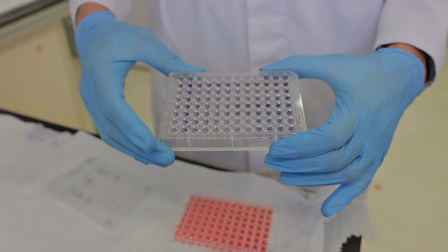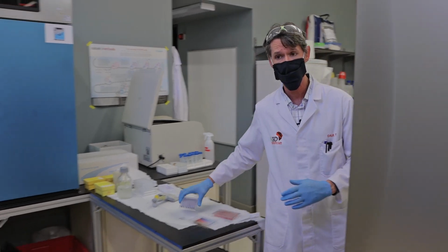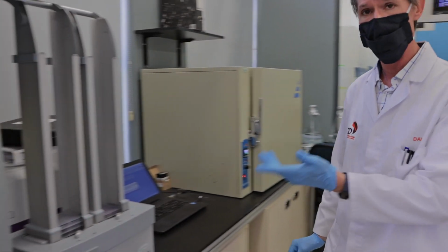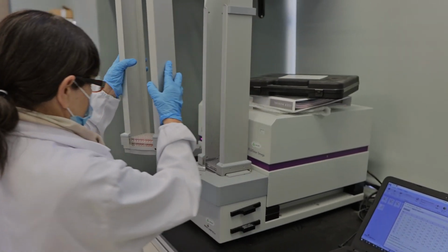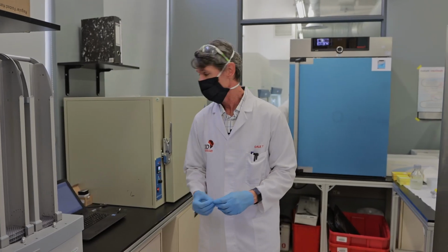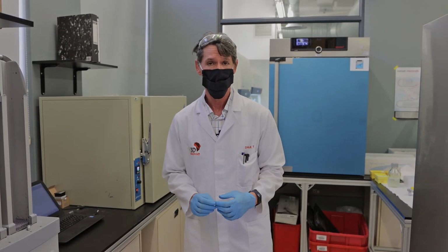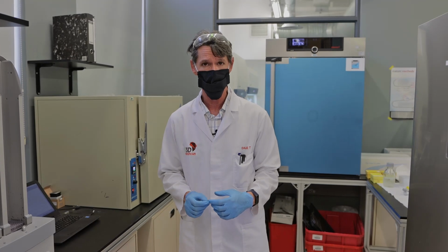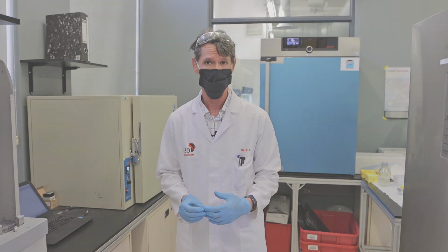Now, I can tell visually what this looks like, but that wouldn't be very scientific. A far better bet would be to put it into this machine here and get an actual numerical result. The plates are taken from the stacker into the spectrophotometer. The optical density is read. It gives us a range of numbers which we can then use to calculate the accurate IC50. That data is then fed back to UCT chemistry and is integral for the next round of design and synthesis of the next round of compounds.